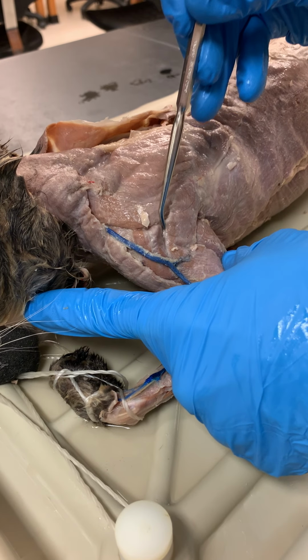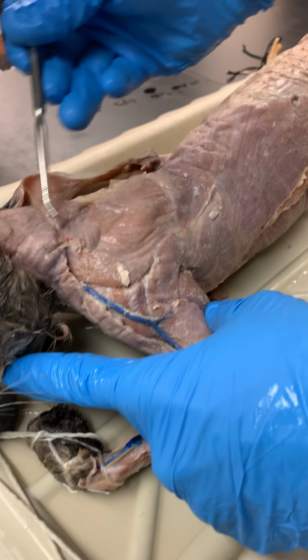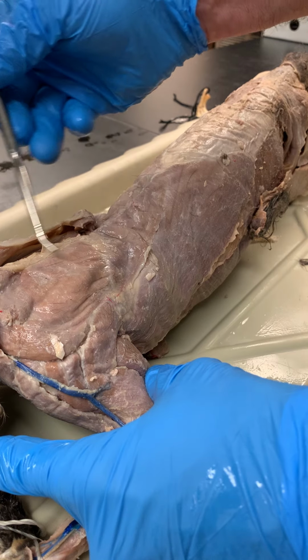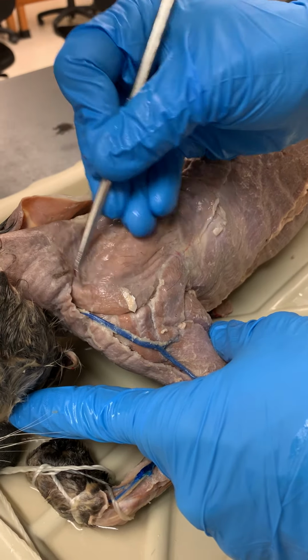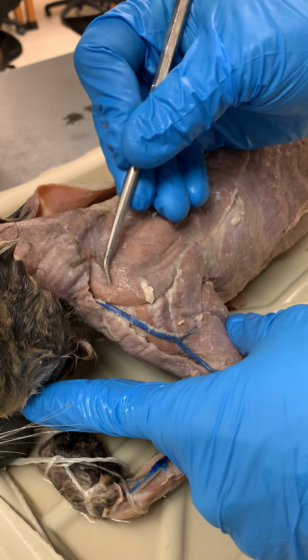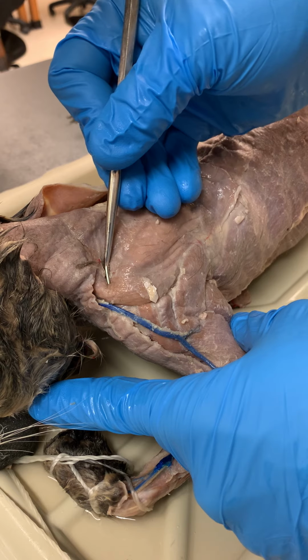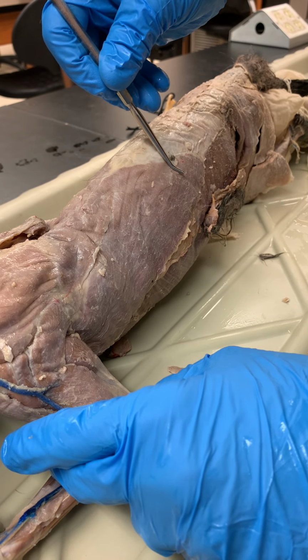Here's our acromiodeltoid and spinodeltoid, CAS. Same thing's going to occur with the trapezius muscles: clavotrapezius, acromiotrapezius, and spinotrapezius, CAS. Seen in the middle here, but not differentiated very well, is a strap-like muscle that's kind of between our clavo and acromiotrapezius. This is the levator scapulae ventralis. And of course, here we can see the latissimus dorsi.